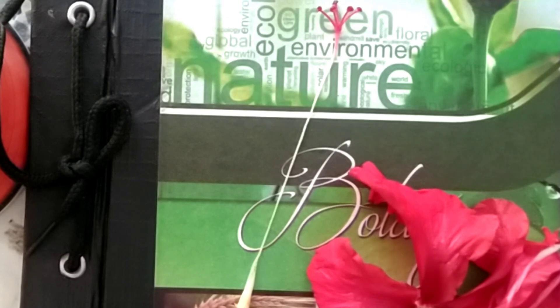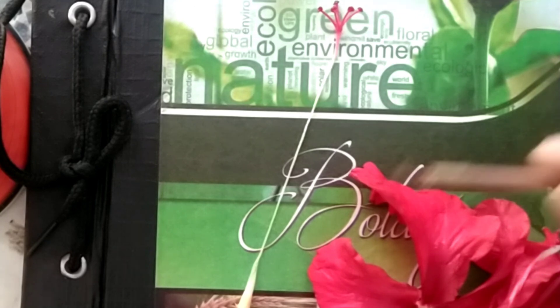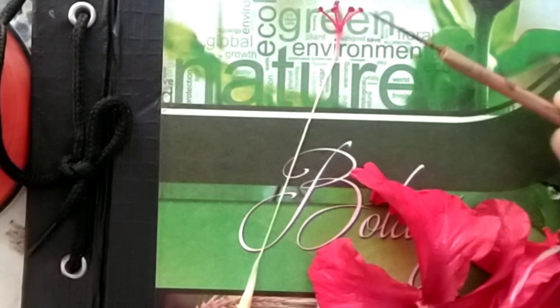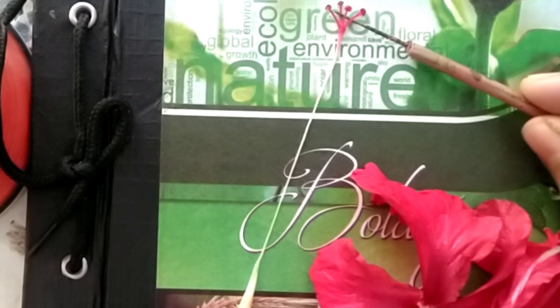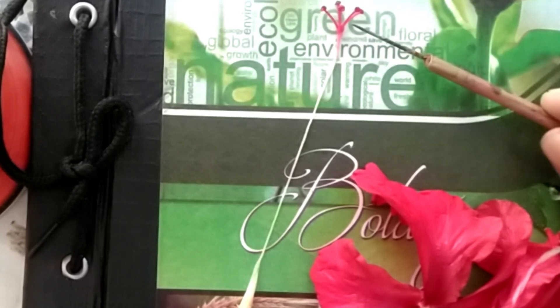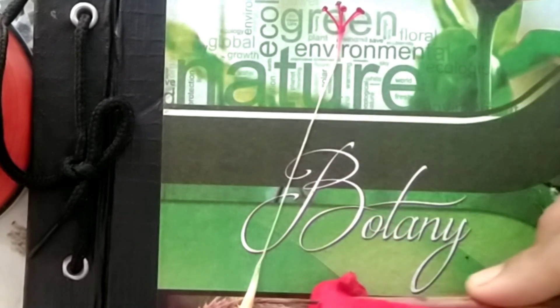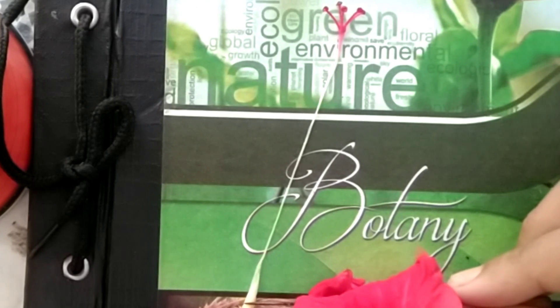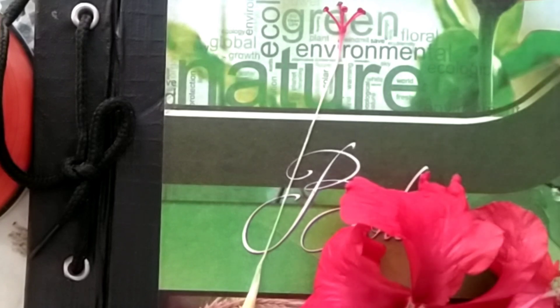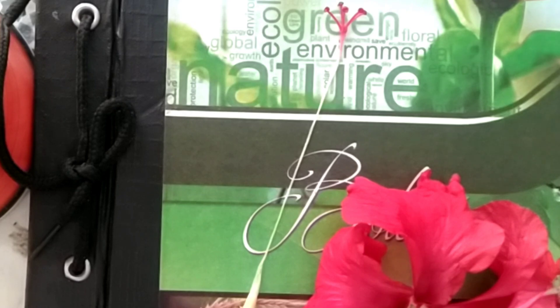This is a perfect dissection — you can see the parts of the gynoecium clearly. The topmost portion is called the stigma. The long part is called the style, and the basal swollen portion is called the ovary. In general, the gynoecium part of the flower contains three parts: stigma, style, and ovary.